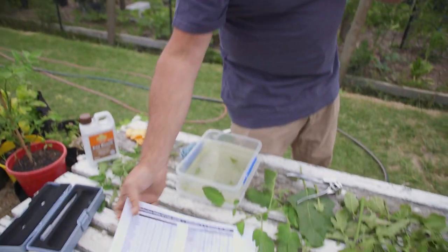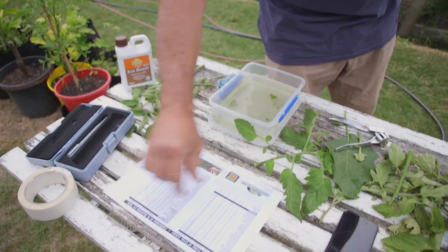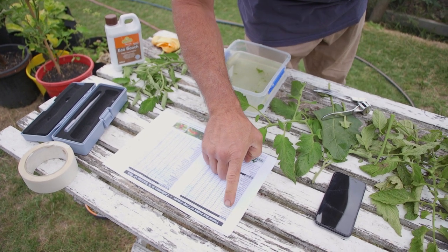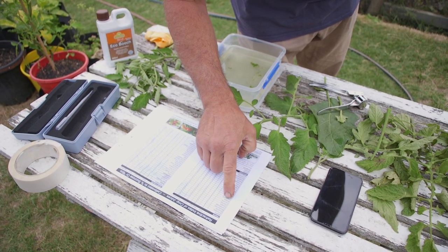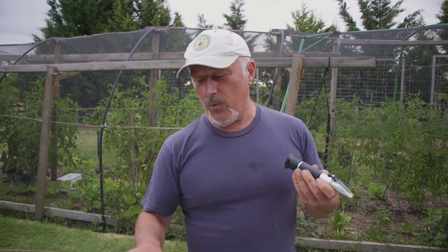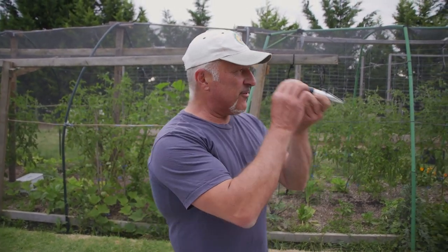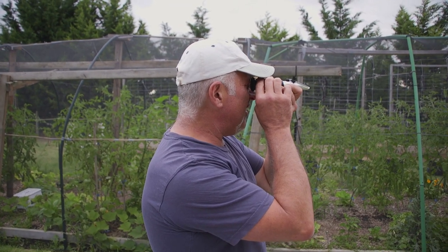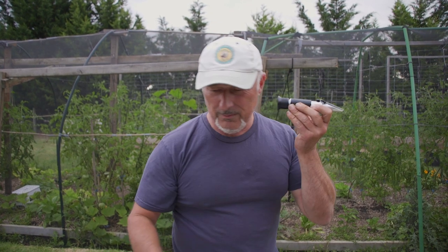That's going to have a different Brix measurement for eggplant compared to tomatoes. Unfortunately there's no eggplant here on the chart, so I'm going to do a little bit of research afterwards and put it online for you to know what it should be from poor, moderate to excellent. But as far as the reading, we're going to compare one and the other. We're sitting at four, just under five.